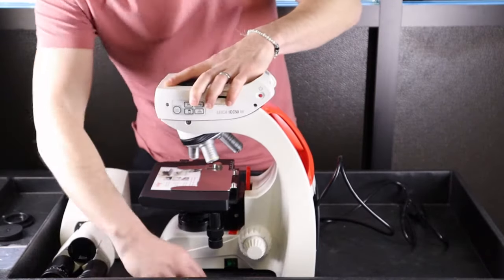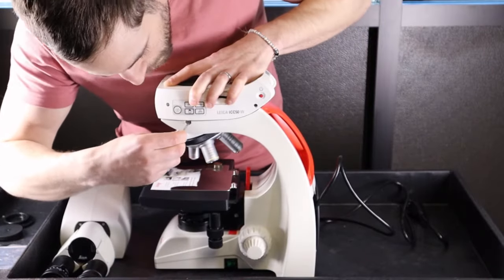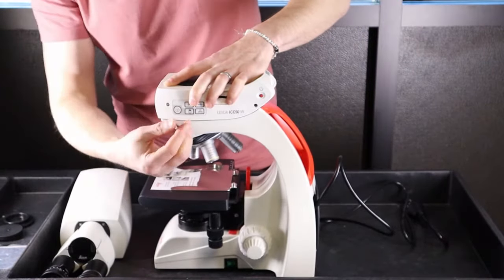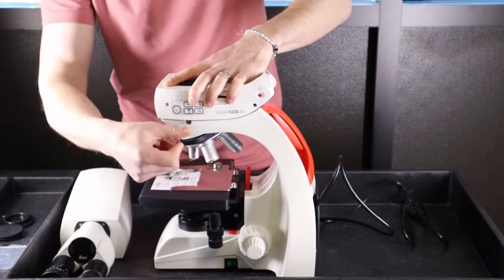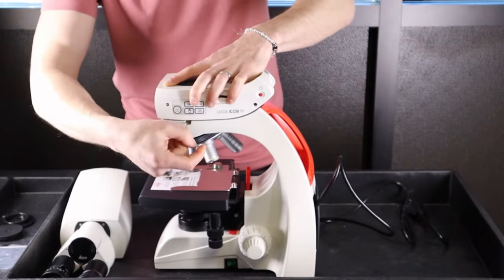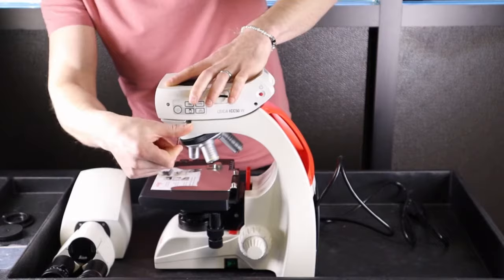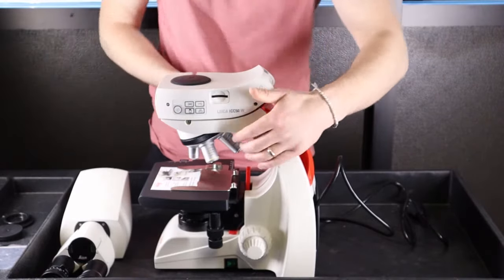Now hold the camera into position and tighten that screw down all the way. Once that's tightened down, you can release that.